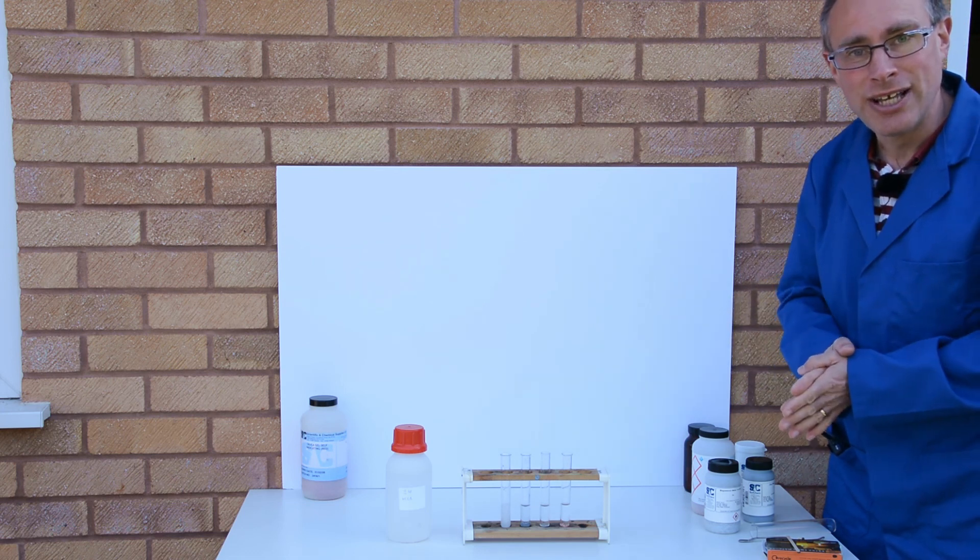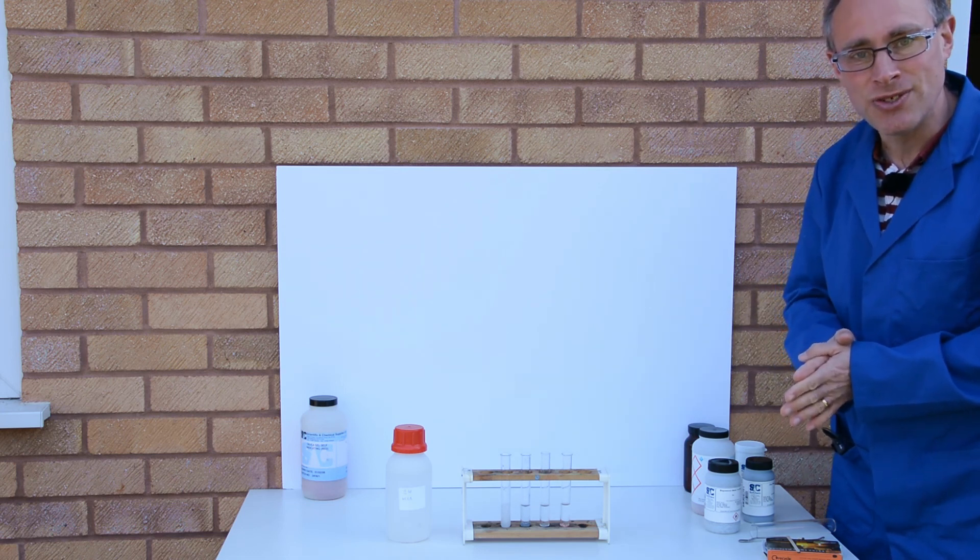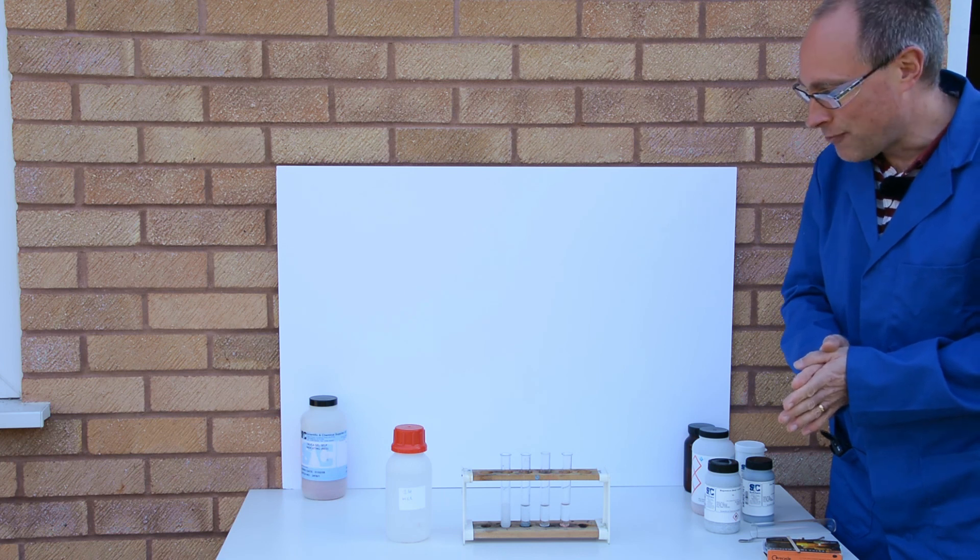And that's the use of acid to deduce an order of reactivity for metals.